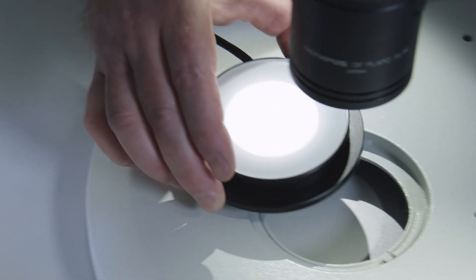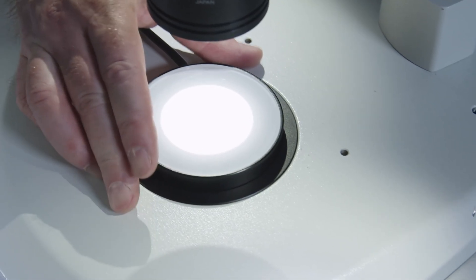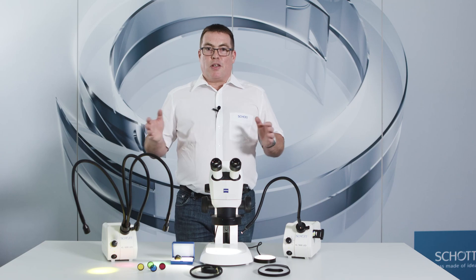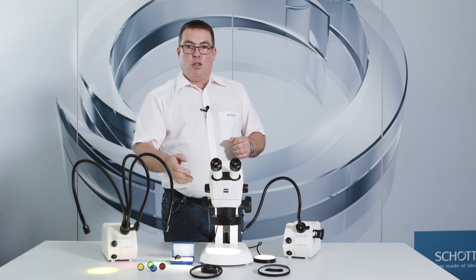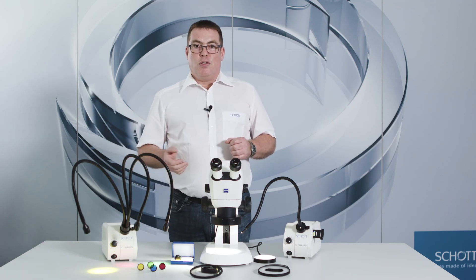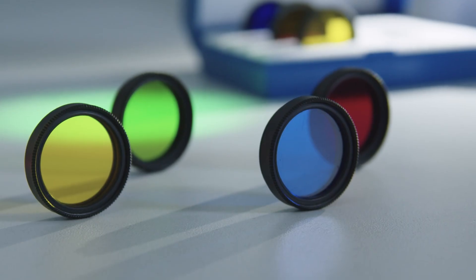This example is using transmitted light. We offer polarization devices for our ring lights, transmitted light stages, focus lenses, and easy LED spots.